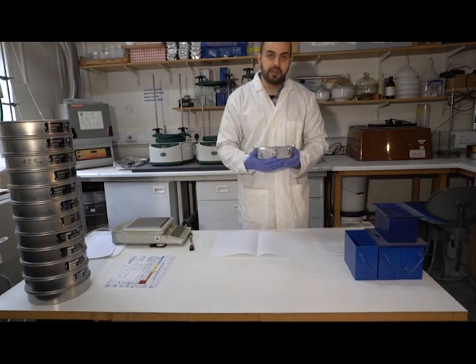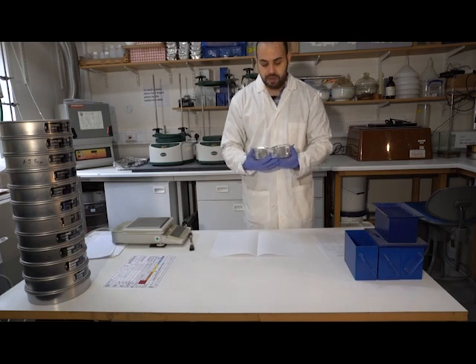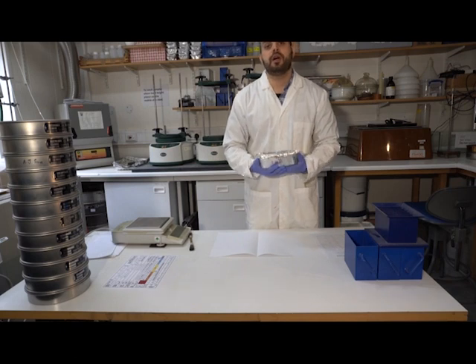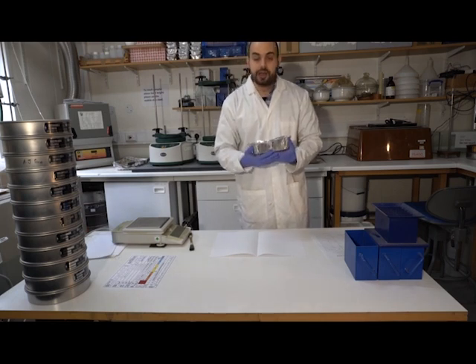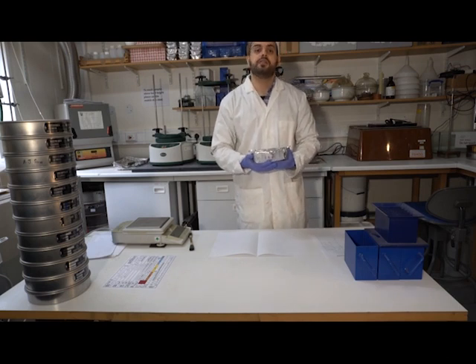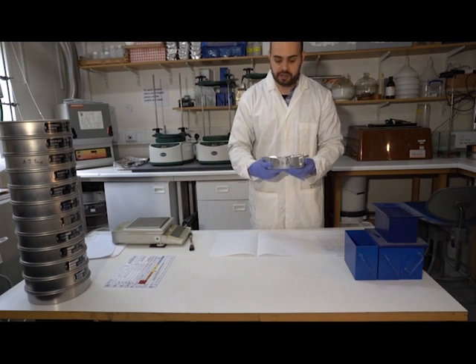Now, if we think there is some mud or silt in this sample that we're interested in preserving, then we need to collect the water that goes through a very fine sieve while we wash these particles, what we call wet sieving, and then allow that water to settle in a column, collect any residue, and analyze that separately from the coarser fraction, the sands and gravels.